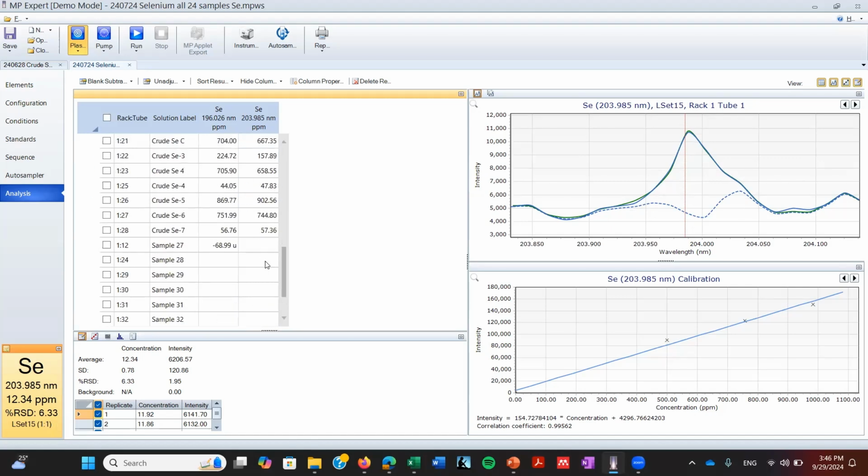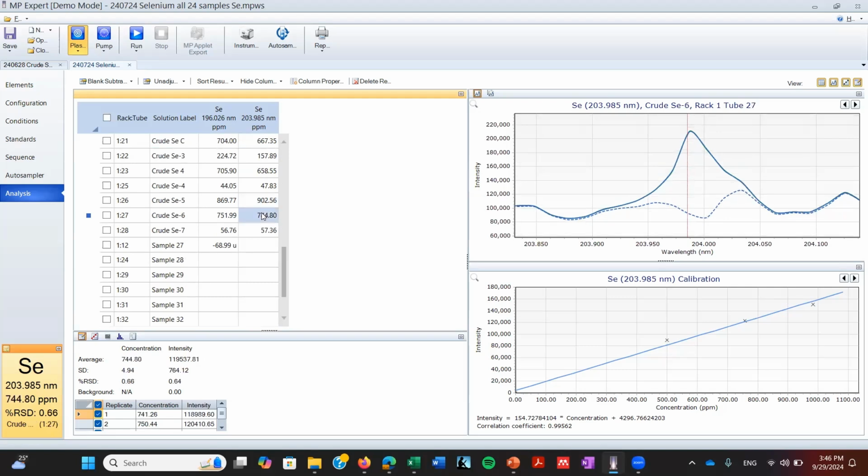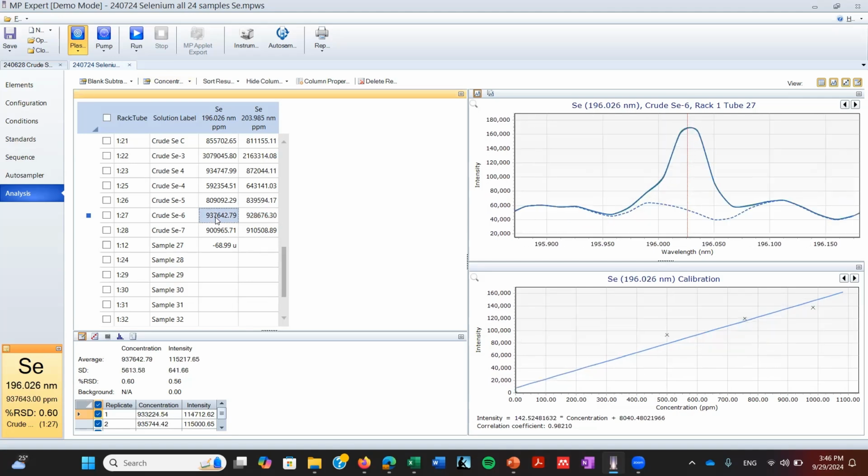But if we go down, we can see that these two data are very accurate. Why? Because they are between the two standards, the lowest and the highest. So once we have that, we can go to concentration. And we know that this is going to be concentration that is relatively good.